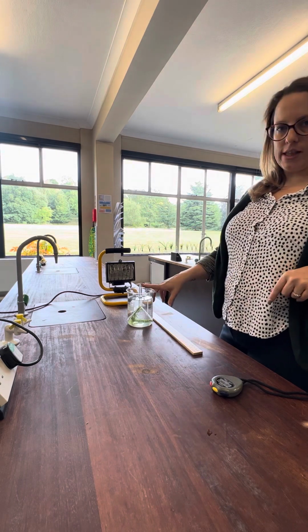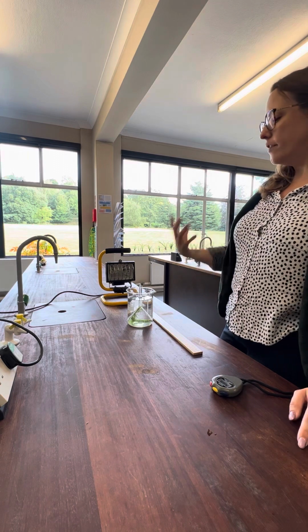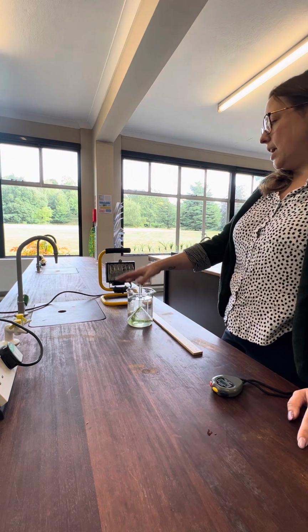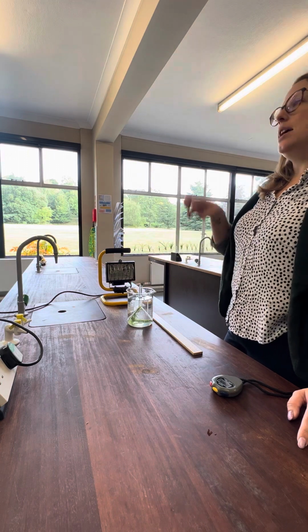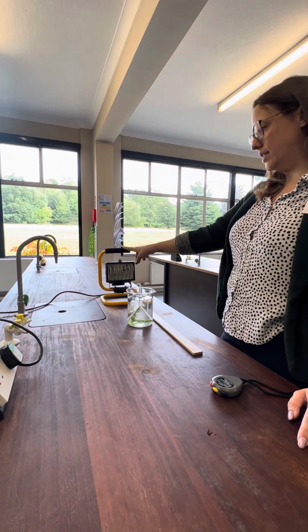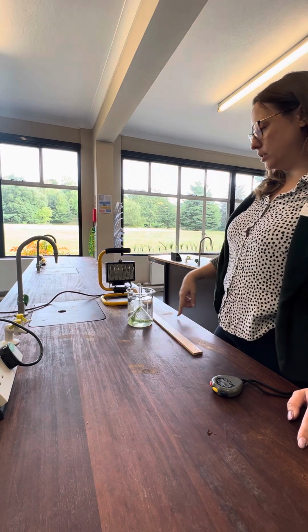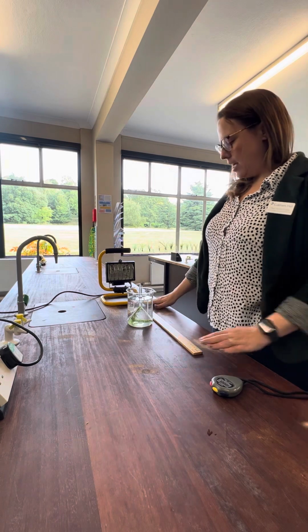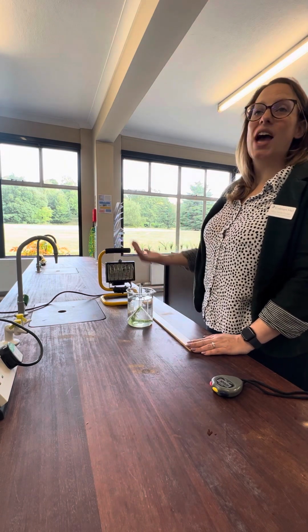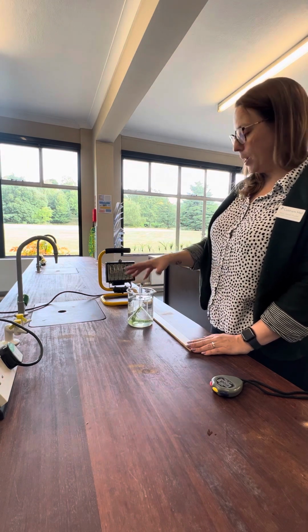the rate of photosynthesis. Now the rate of photosynthesis is how quickly photosynthesis is occurring in this organism, and I want to see if the amount of light that it gets is going to affect that. So my independent variable is light intensity. I'm going to change that in this practical by having a lamp at a set distance from my pondweed. So I'm going to change the distance that my pondweed is from the lamp, okay?